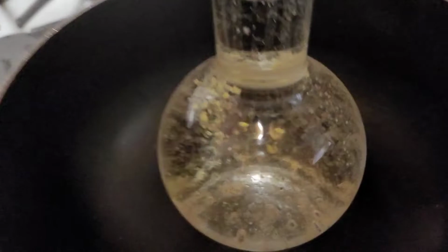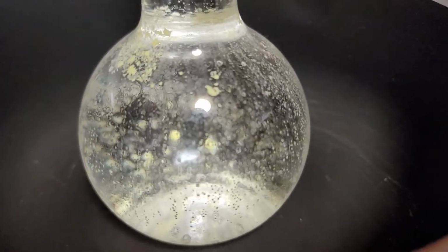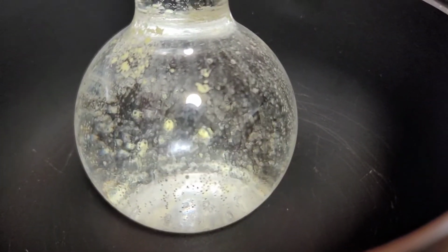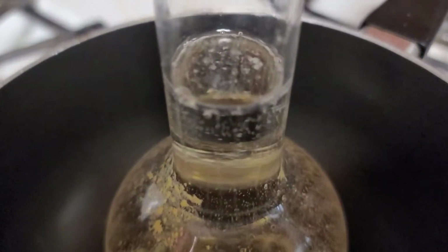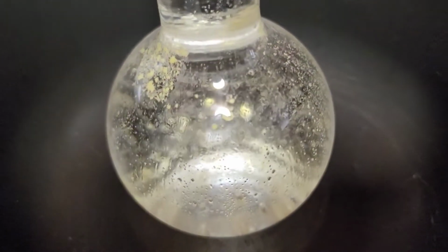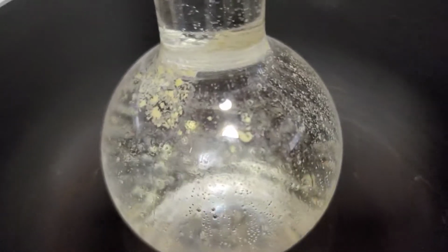The stuff that's stuck to the insides of the glass is gradually breaking loose in the heat and mingling with the water at the surface. You see it's coming up to the surface of the water. So I'm just heating the glass with distilled water inside it.